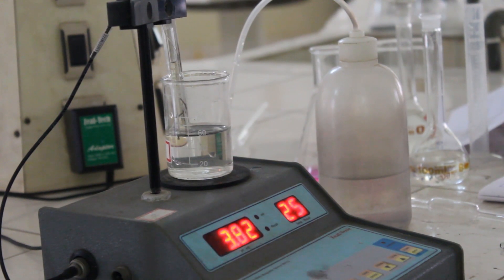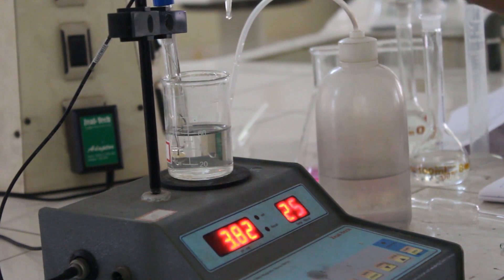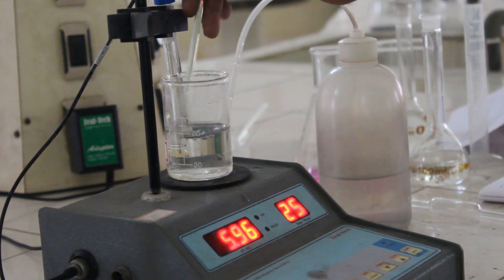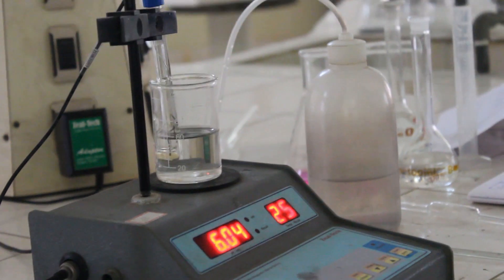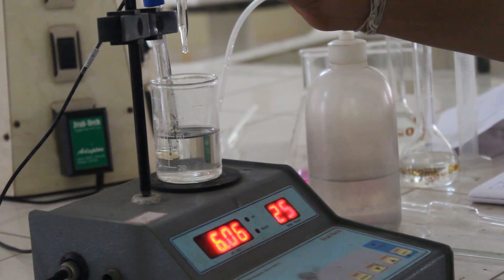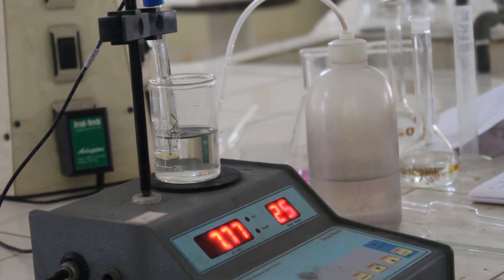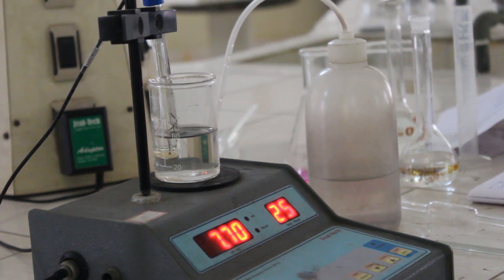At a particular point, we will observe a sudden jump in pH. Remember to add 0.1 ml of sodium hydroxide solution from the burette. Please observe: another 0.1 ml of sodium hydroxide will make the change from acidic pH to alkaline pH through a neutral value of 7, which indicates the completion of the chemical reaction — meaning the stoichiometric chemical reaction has been completed.